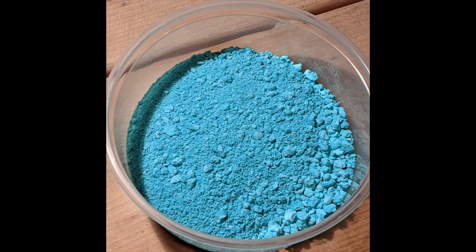Basic copper carbonate is a very useful copper compound that has found use in the past as a pigment. There are many YouTube videos that use basic copper carbonate to obtain pyridine from niacin, but I plan to use it as a gateway to a large assortment of copper compounds. I plan to document the preparation of these copper compounds in a series I'll call the copper series.